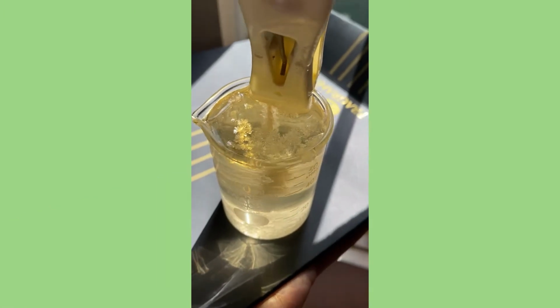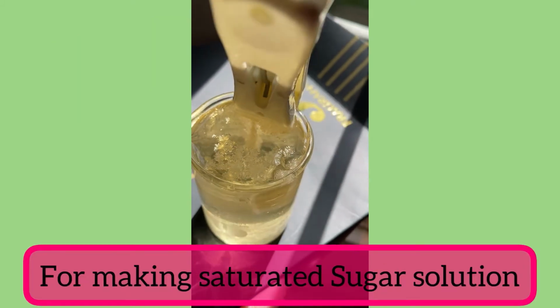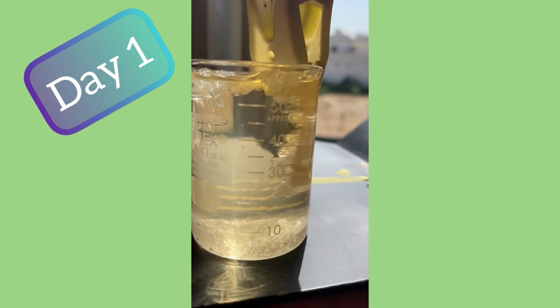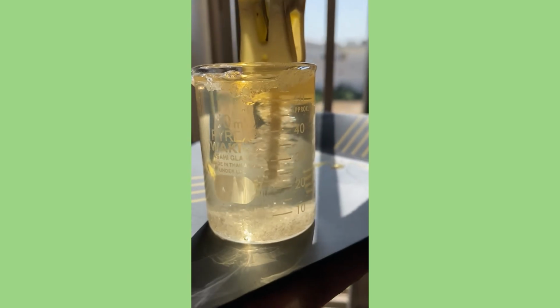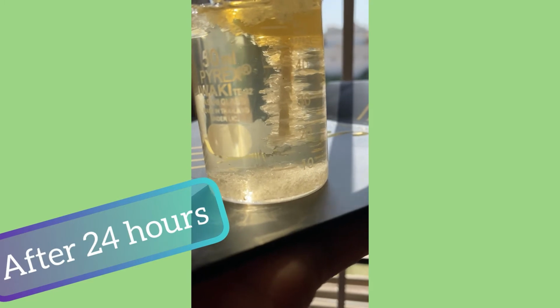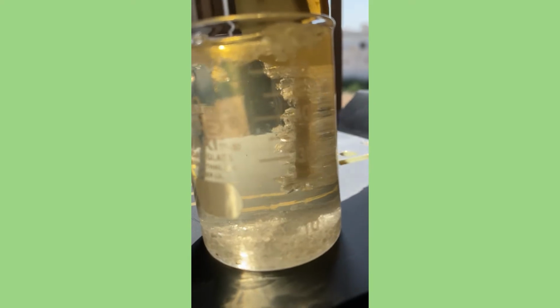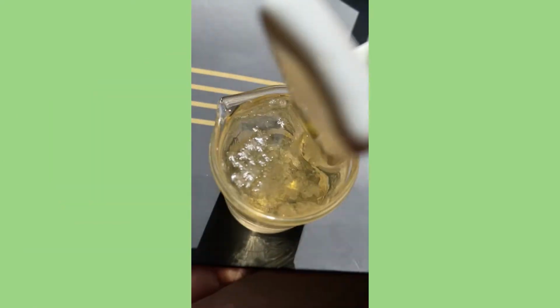So this is another example, right? With the same process, you can see the crystals, how fine they are being formed. And now I'll show you the matchstick that has been immersed. Just see the crystals, beautiful crystals that are formed, and still they are forming. And at the bottom of the beaker also you can see it's the same process, and at the top also you can see a lot of crystals.